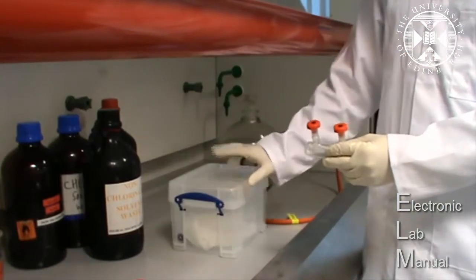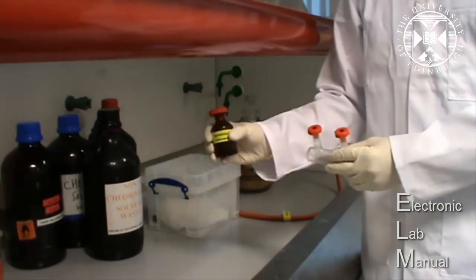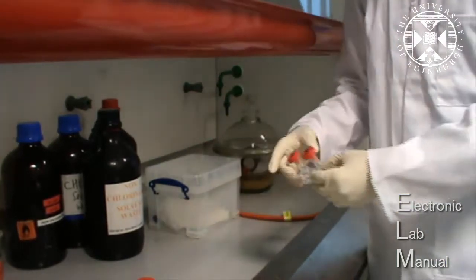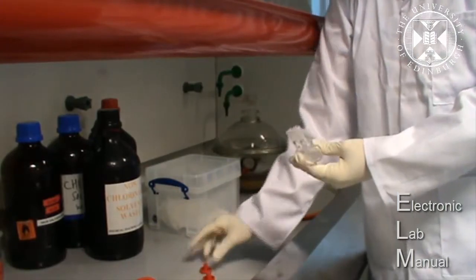You'll find this in this clear plastic box with the Teflon lid and a bottle of concentrated hydrochloric acid. So the first thing to do is to remove the Teflon lids from the gas cell.